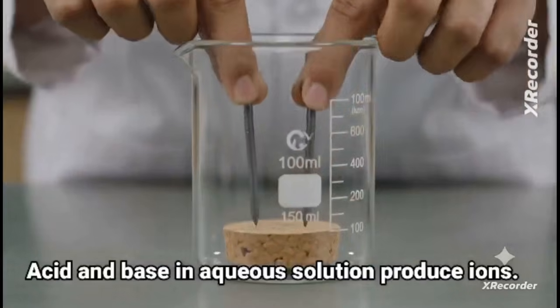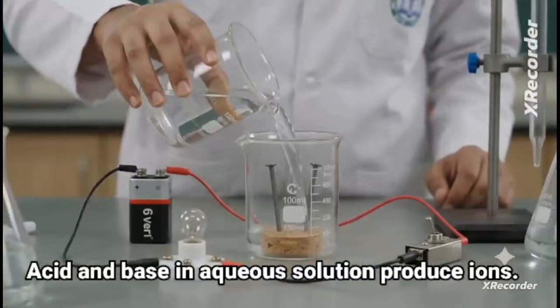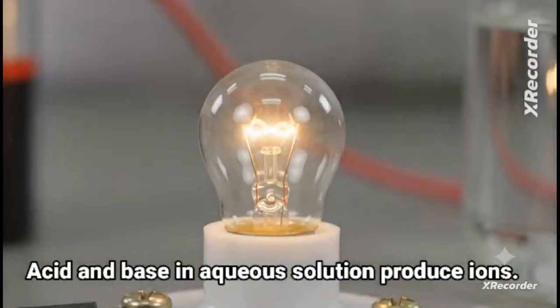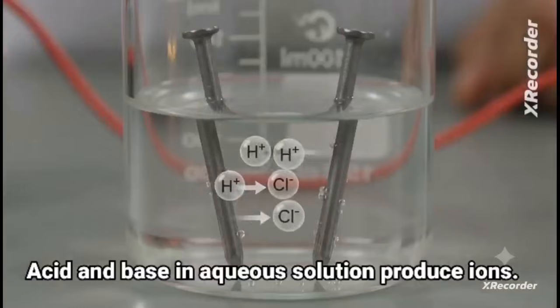Fix 2 nails on a cork, place it in a beaker. Now pour dilute acid and switch on the current. Now observe that the bulb is glowing. Electric current is carried through the solution by ions.